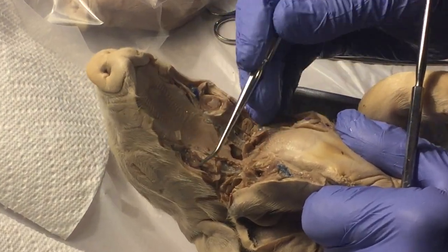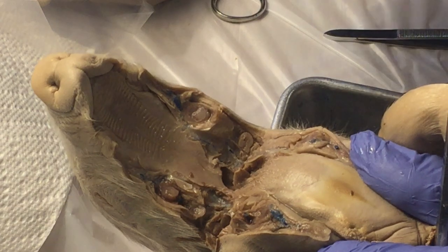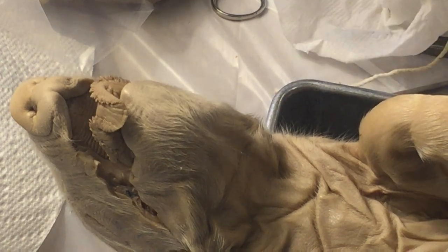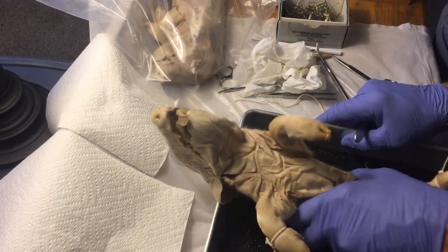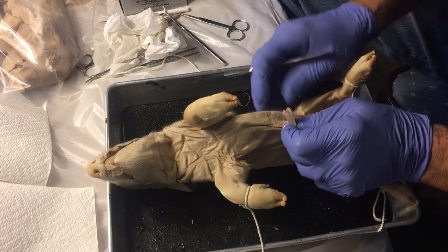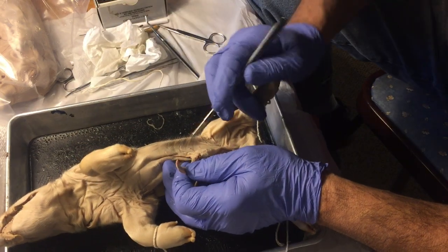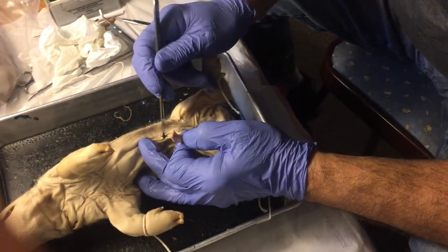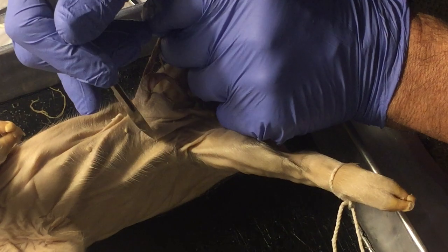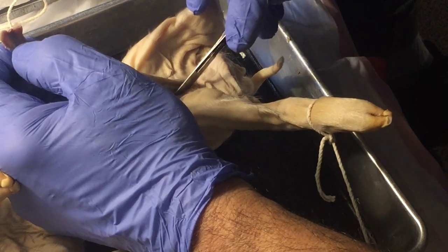There are some early-form teeth here. So you've got the oral cavity — that's the first of a series of different cavities we're going to be looking at. Now I'm going to open this pig up. If you look in your lab manual on page 75, I'm going to do a horseshoe-shaped cut around the umbilical cord, pulling up on it as a handle.